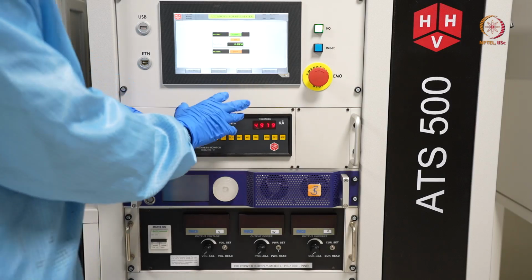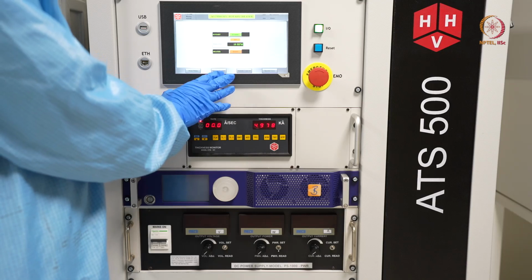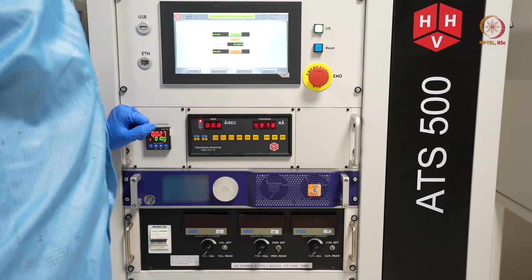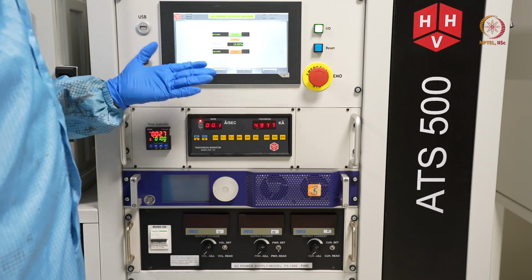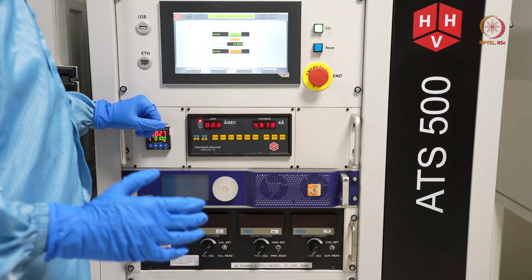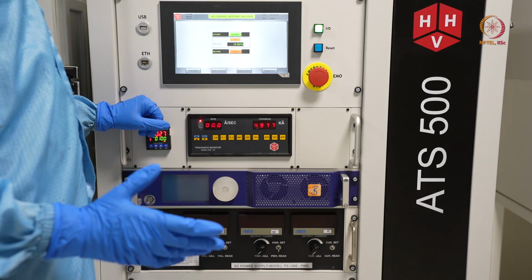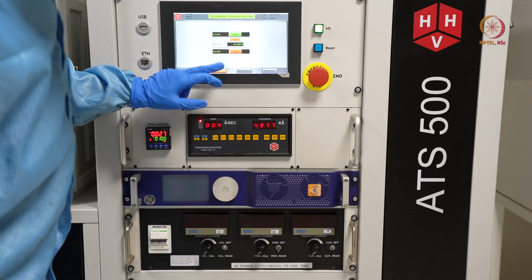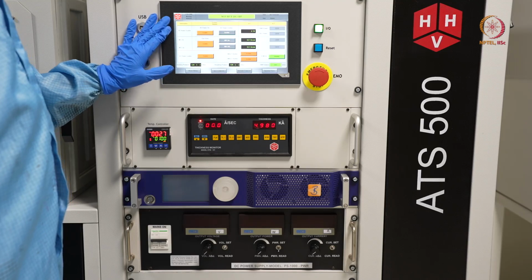For that, we came to that ACC control again, and we changed this rotary drive to 10 RPM. It was set at 5 RPM. So now we set it to 10 RPM. Your uniformity can be governed by this. So you can change this 5 RPM, 10 RPM, and optimize the parameters as per your tool. Now let us go to source control. This time we will try with RF power.